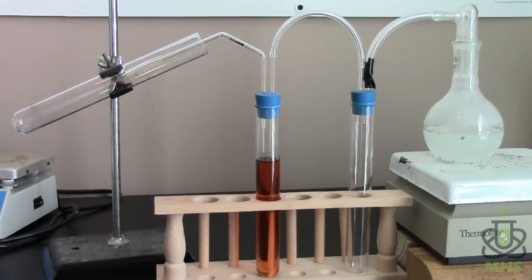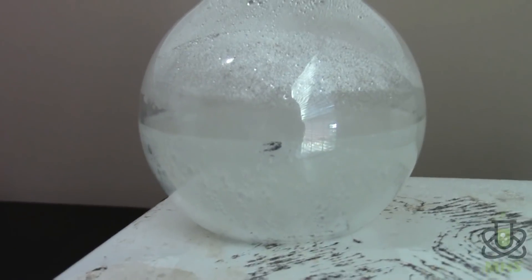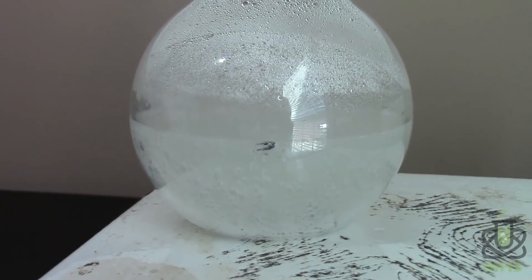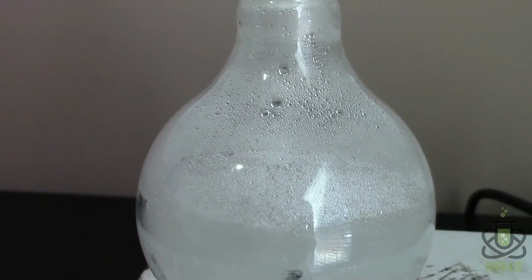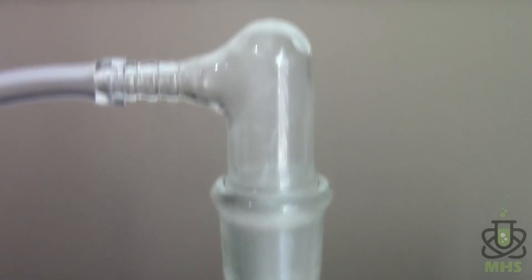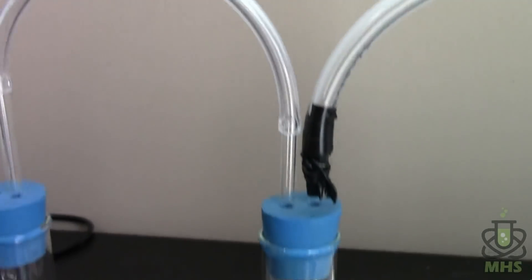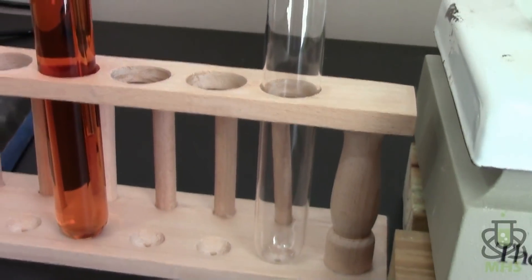Now we're producing nitrogen but it's coming from a hot aqueous solution which means there's also a lot of water vapor that comes off with it. So if we want a nice pure nitrogen sample we're going to have to try to get rid of that water somehow. And that's the idea of this setup here. So our nitrogen is getting produced over here which you can see from the bubbles as well as a lot of water which you can see from the condensation.